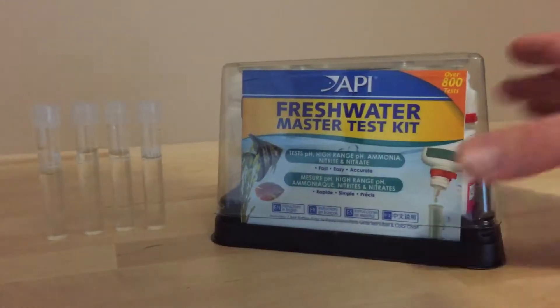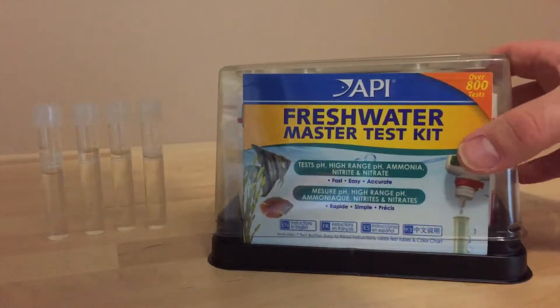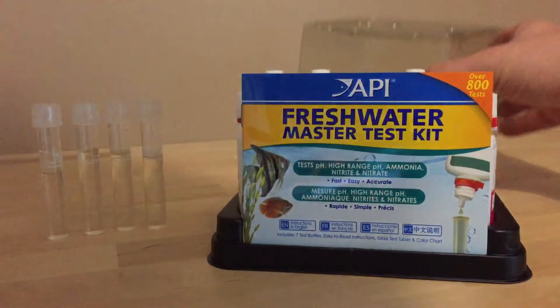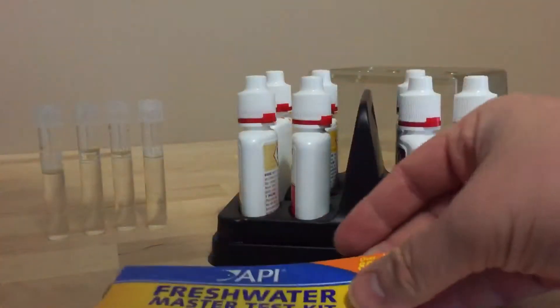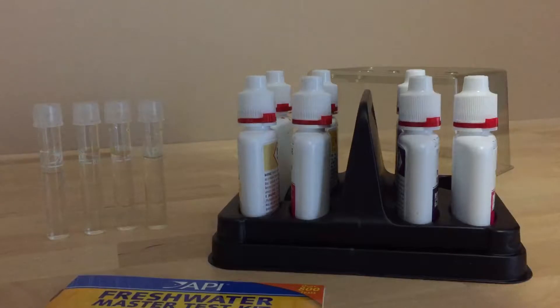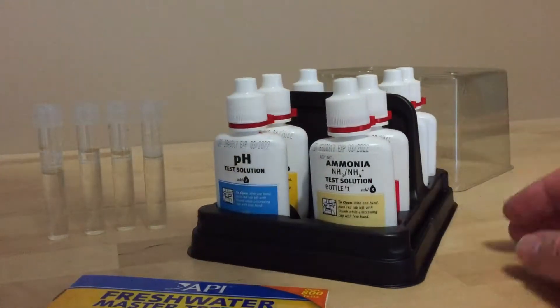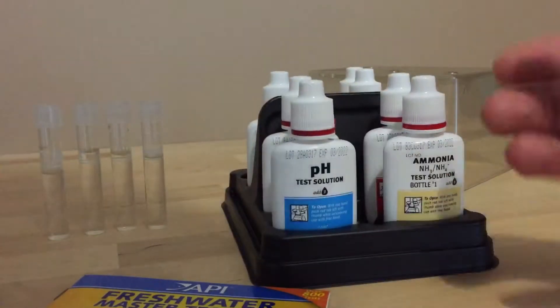Okay, in this video I'm just going to show you quickly how to use the API freshwater master test kit. This test kit I really recommend if you're setting up a tank or cycling a tank or just for ongoing maintenance to really keep an eye on all the different tests that you need to do in your tank.